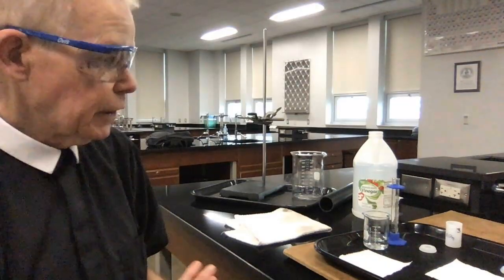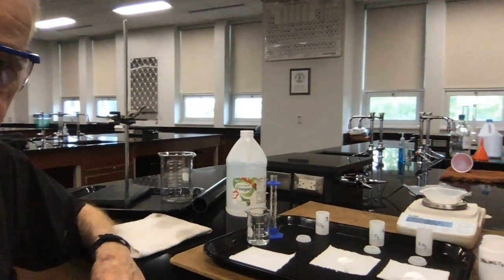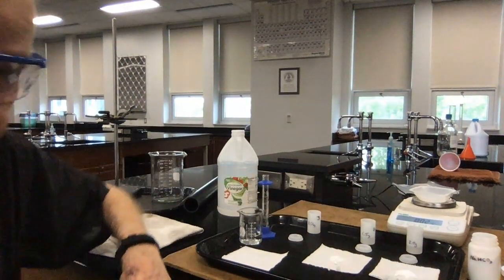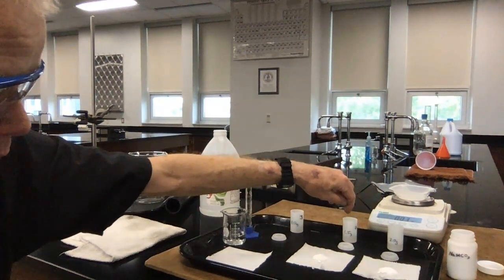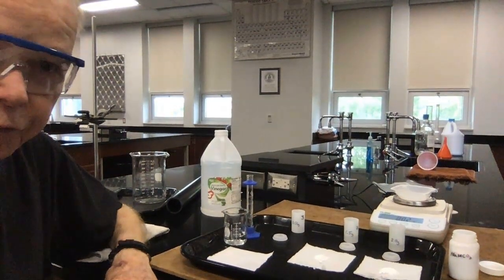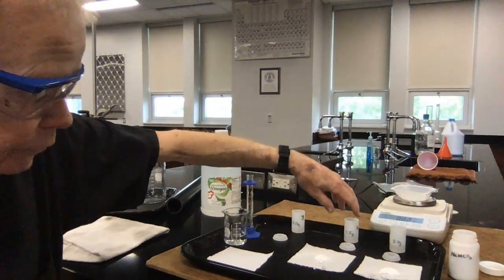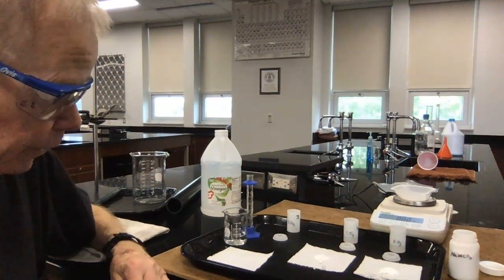Let me now show you a little bit of the equipment that I have on the lab tabletop here. In the background, you'll see a bottle of vinegar, and on the right, I have an electric scale, and in a small container here, I have my baking soda, a little vial of it, and then in the background, I have some film canisters. That used to be something that people would buy their film in when there were cameras that used film. I've labeled them. This is my 2 gram quantity, this is my 1.5 gram quantity, and the one I haven't filled yet is going to be my 1 gram quantity.